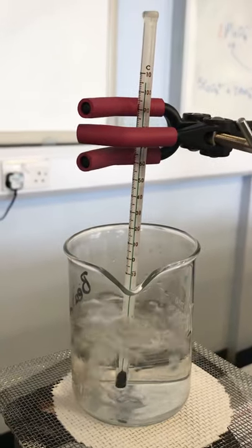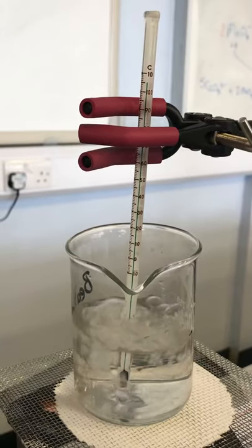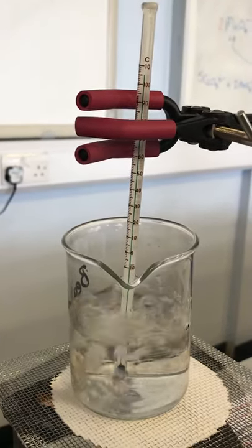Once you see the water starts to bubble and lots of water vapor is being released, take the final temperature reading.